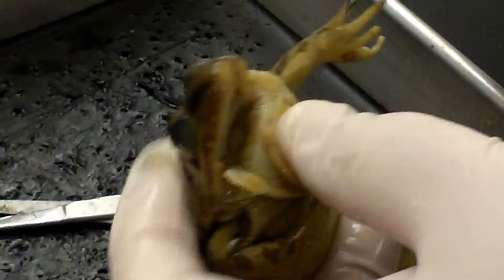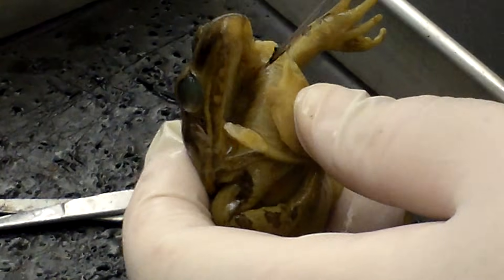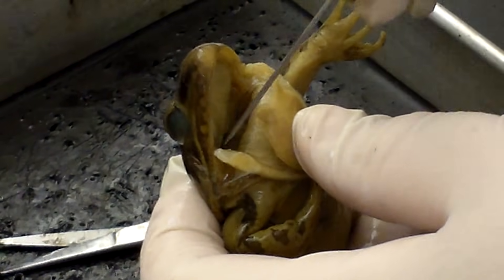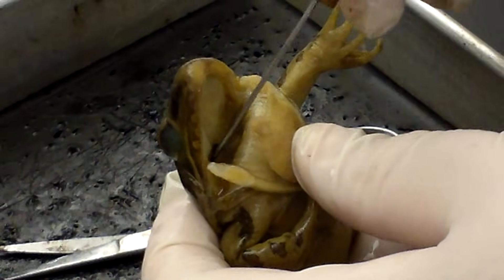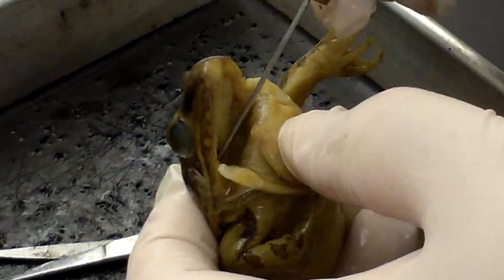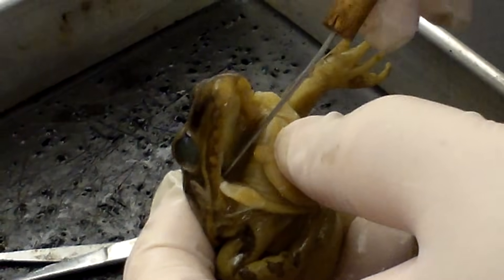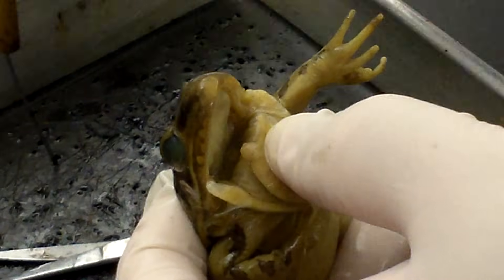In the back, there are tubes that open into the ear canal where the eardrum is — those are called eustachian tubes. Eustachian tubes are the same structures that we have, connecting our nasal passage to our ears. When we get an ear infection, our ears feel clogged — mainly because that eustachian tube is plugged and we can't hear because we get fluid behind our ears.